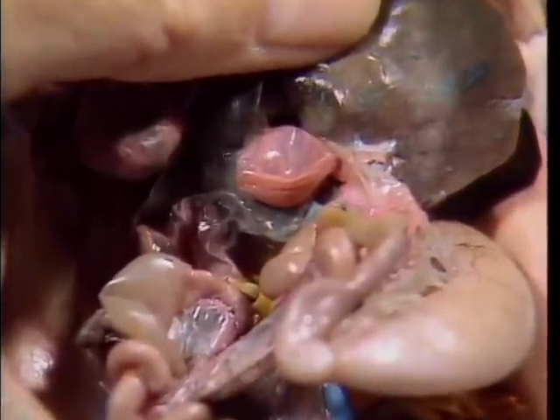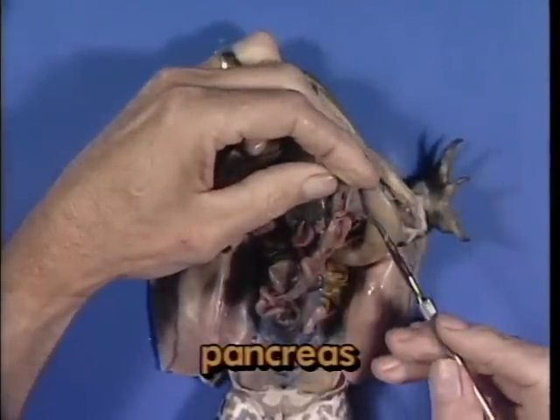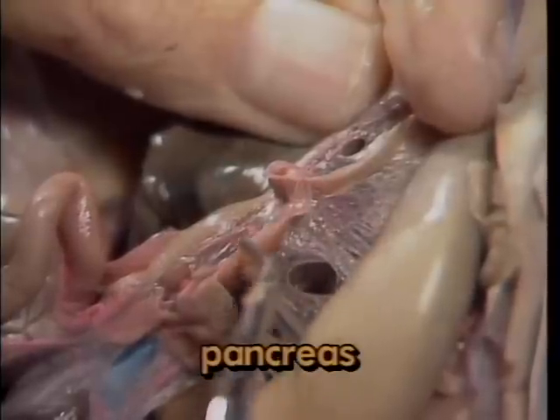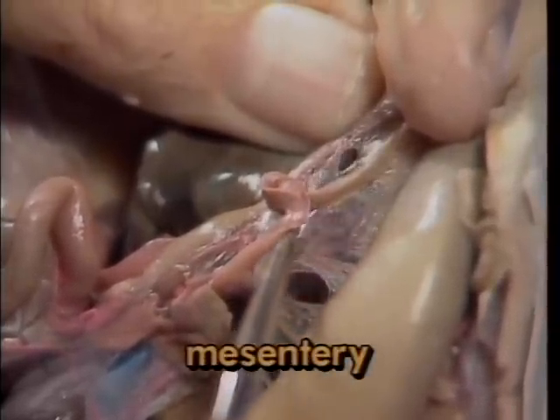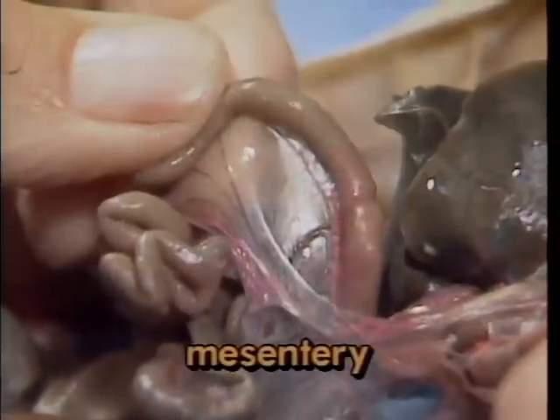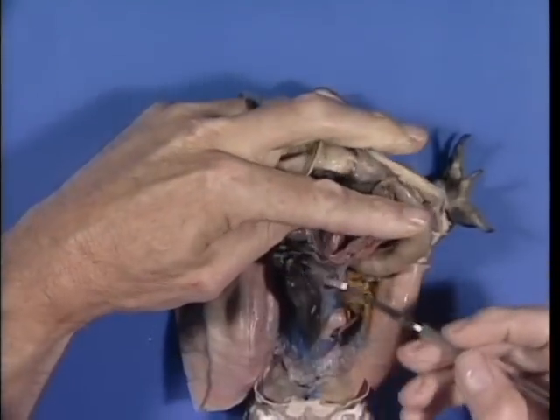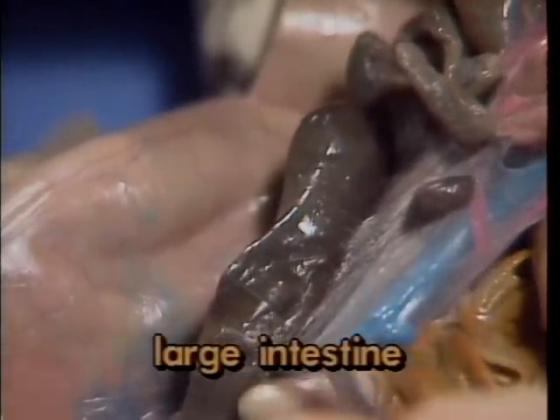Several digestive enzymes are produced by the pancreas. The pancreas lies between the stomach and the adjacent intestinal wall, embedded in a thin, translucent sheet of support tissue called the mesentery. The small intestine is also supported by mesentery. The small intestine terminates here and is followed by a short enlarged region called the large intestine.